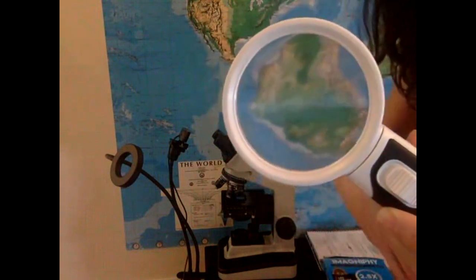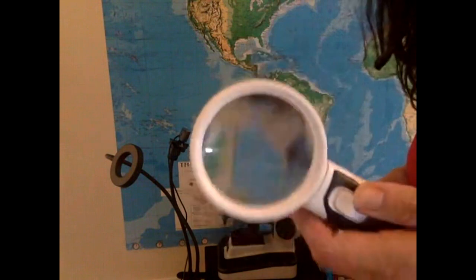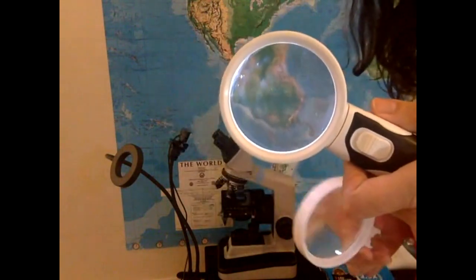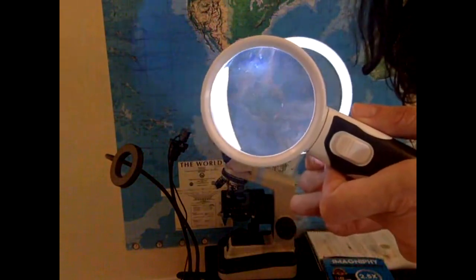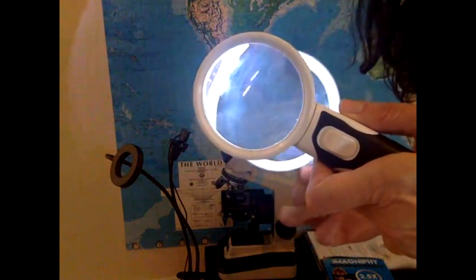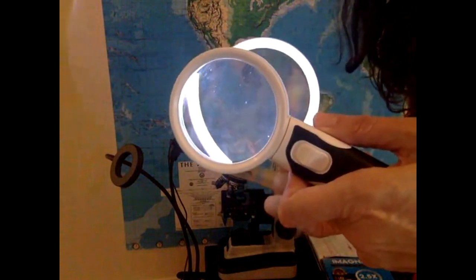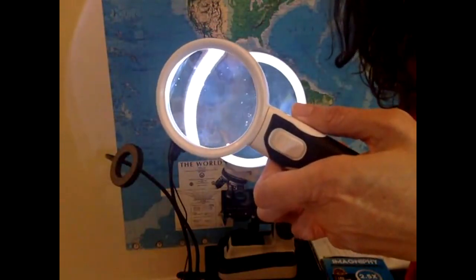And then I do this. All right. And then let's see if it's going to make it better. There we go. There has to be some light. And then I do this. Now, you have to do the correct distance from the object for things to be in focus, which I'm failing right now to do. The microscope is actually easier than what I'm trying to do here.